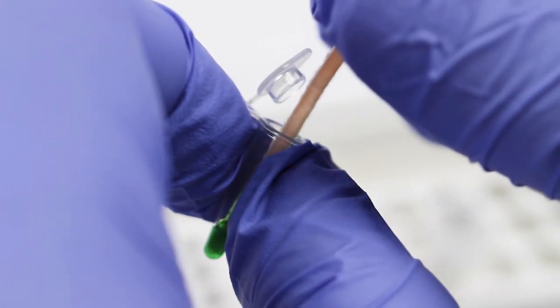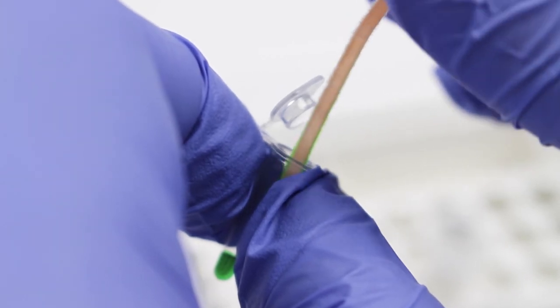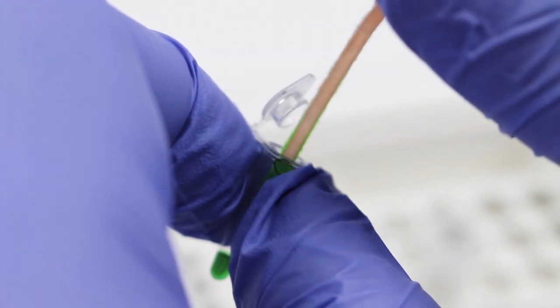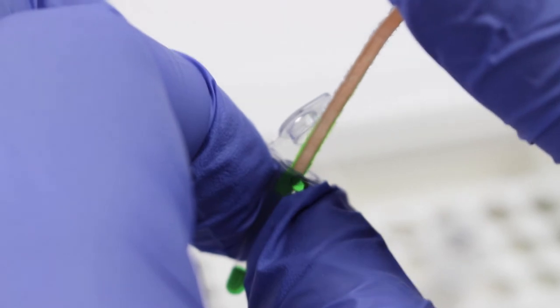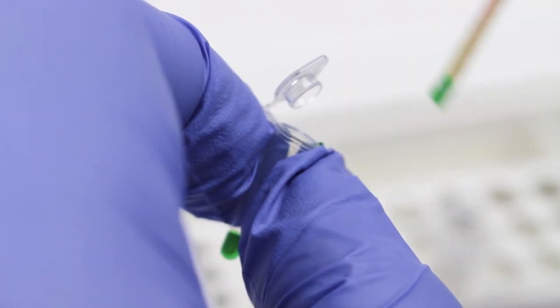After dipping, wipe the dipstick on the edge of the PCR tube to make sure that there's no large droplets of PCR reaction mix left on the dipstick. The PCR reaction is now ready to go.